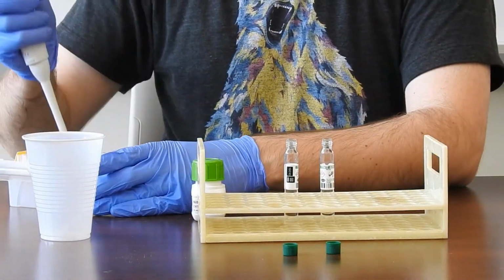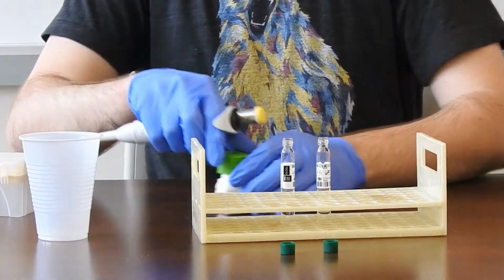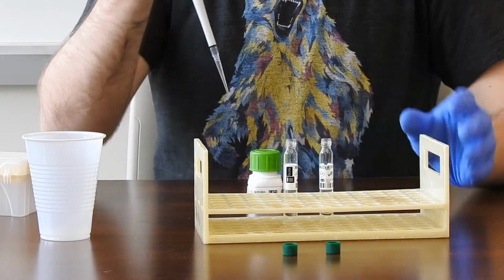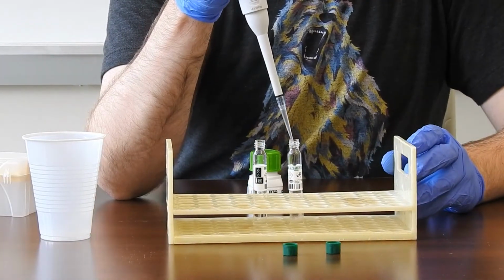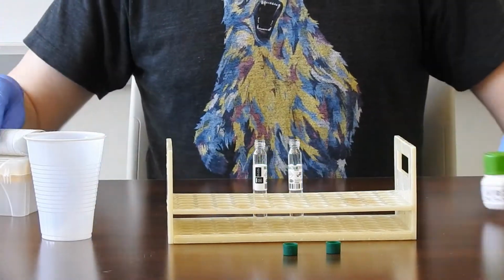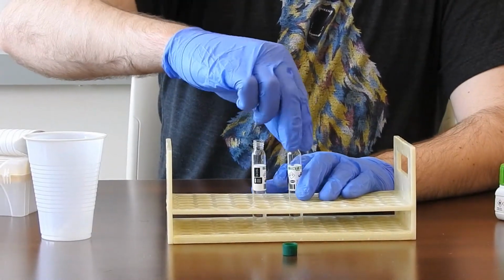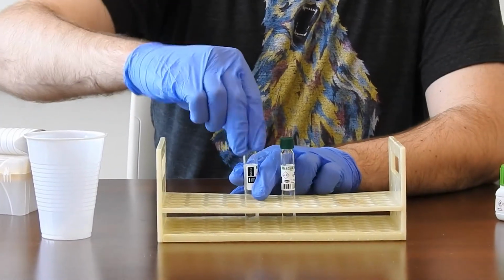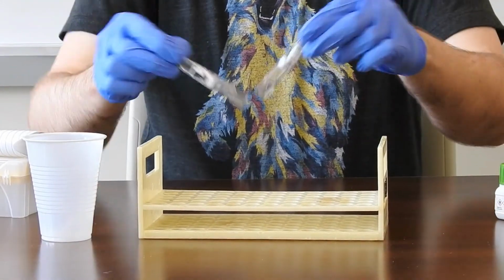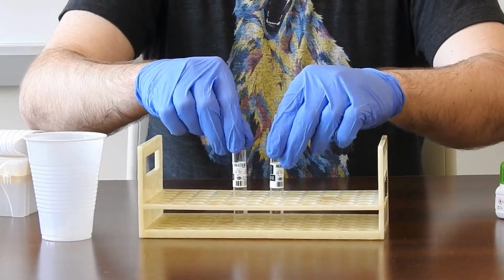Some of our reagents are light sensitive. With this one, it simply emits a noticeable smell. And again, you'll notice that I remove pipette tips between samples to assure that there's no cross-contamination if I've touched the bottle with the end of the pipette tip. Once you've finished pipetting both, you'll then invert 3 times to make sure that they're thoroughly mixed.